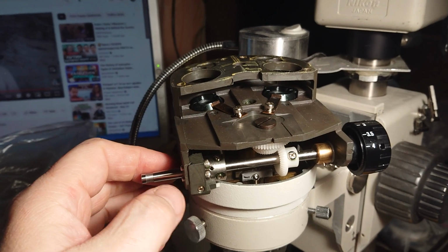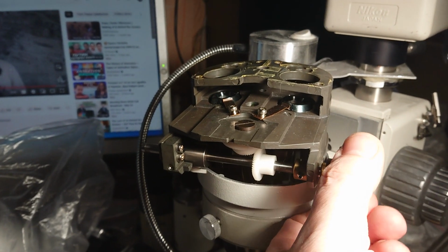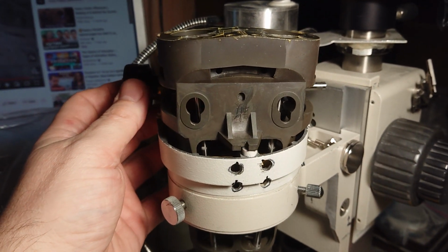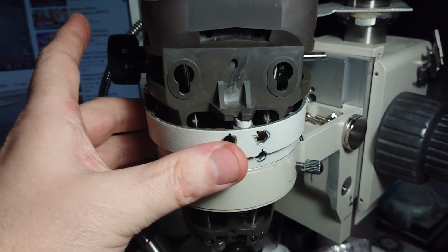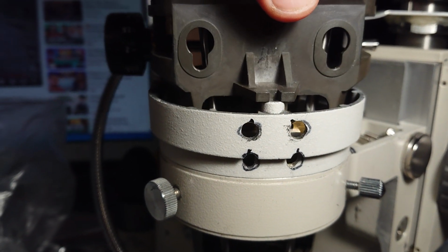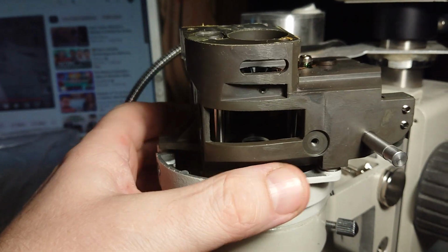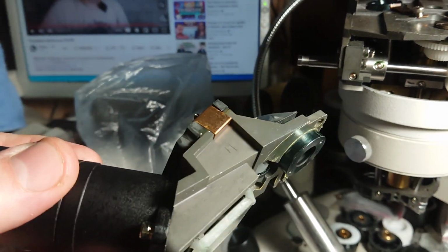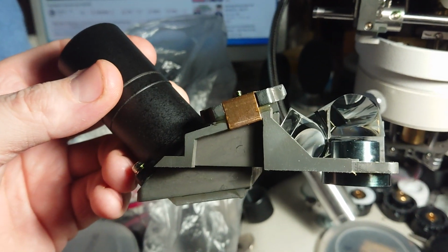Here are some internal parts of our Nikon SMZ-745, and you can see a zoom module that is detached from the erecting system. Here's the zoom module. To make some proper adjustments, I had to cut one of the bodies down to reach some internal screws. So it's one part here, and the other part we are interested in is our erecting system with 45 degrees inclination.